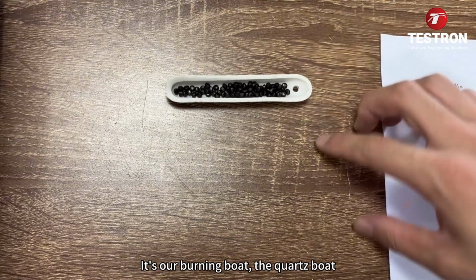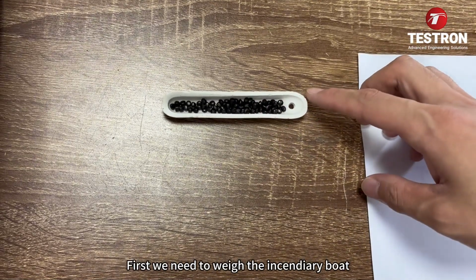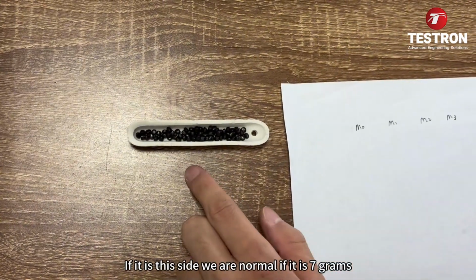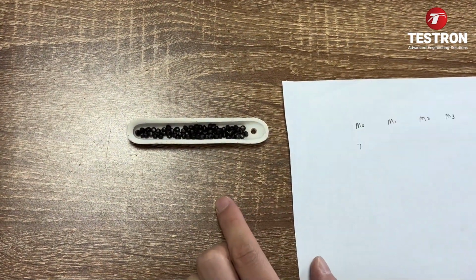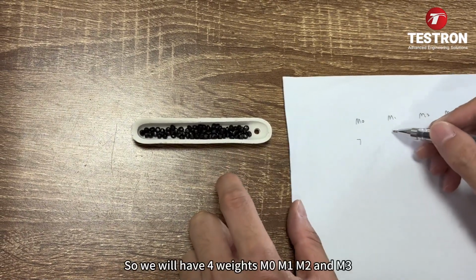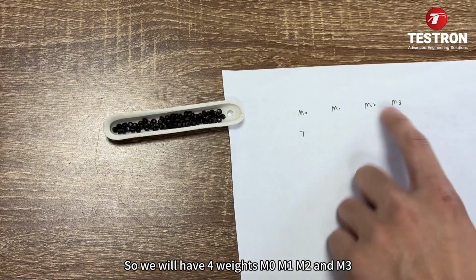It's our burning boat, the quartz boat. Here are our samples. First, we need to weigh the burning boat. If it is this side, we are normal. If it is 7 grams, we normally need to press a sample of 1 gram. So we will have 4 weights, M0, M1, M2, and M3.